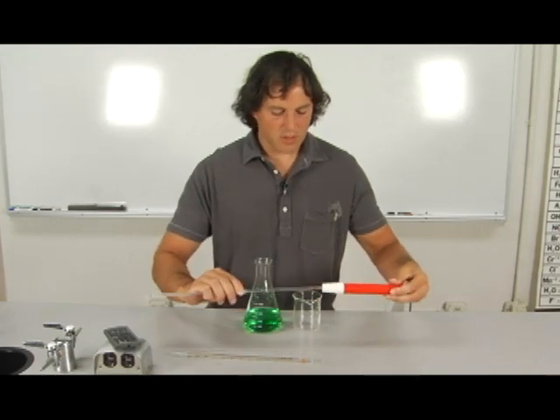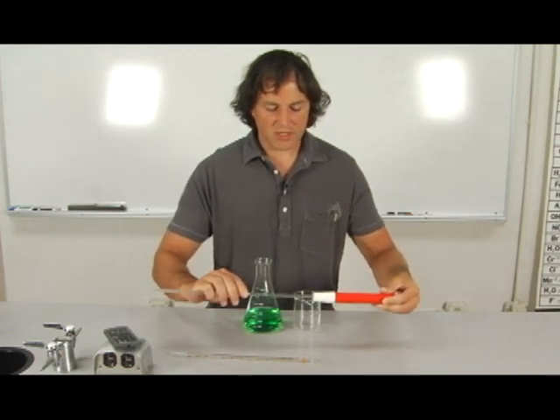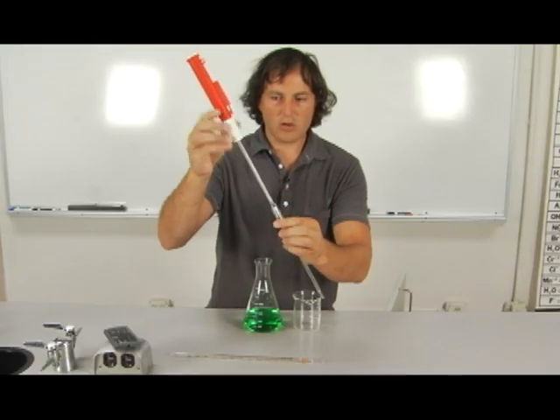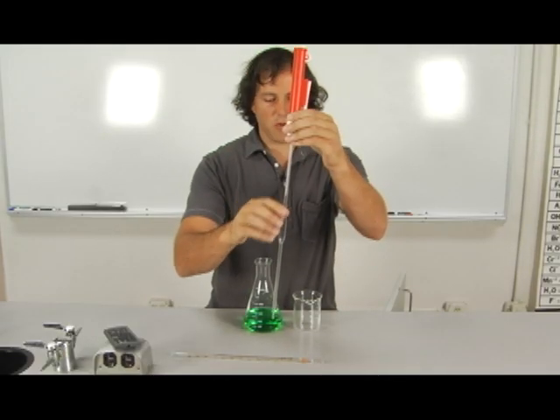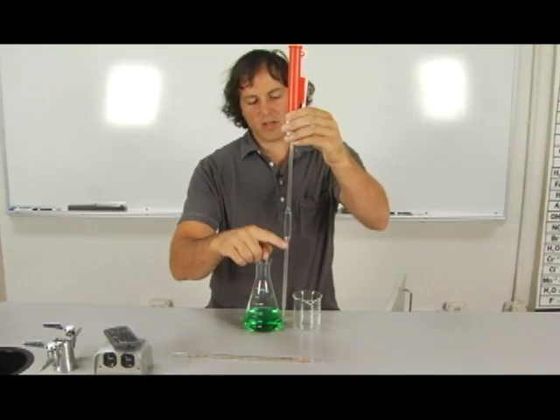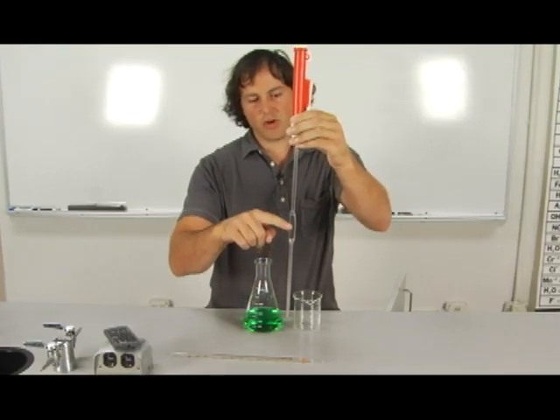So let's use the volumetric pipette. That gets inserted firmly in here. Important to note, do not allow fluid to pass up into the pipetter. Second that's important to note is this will come up quickly and then it will flow slowly as you draw out.